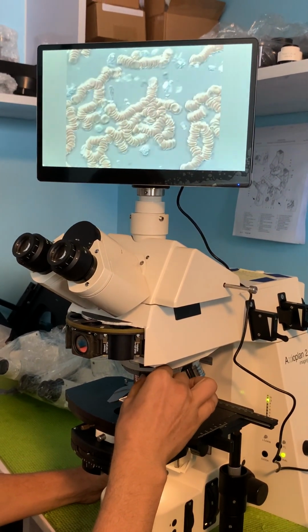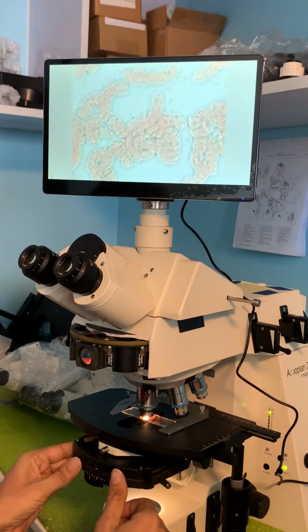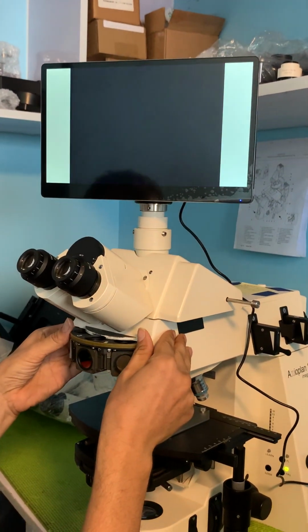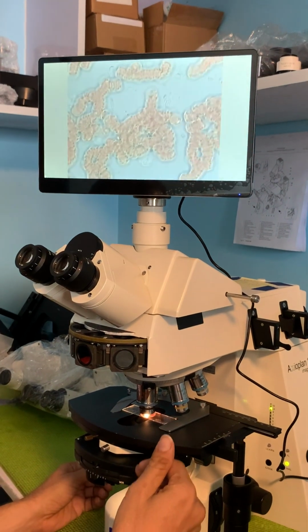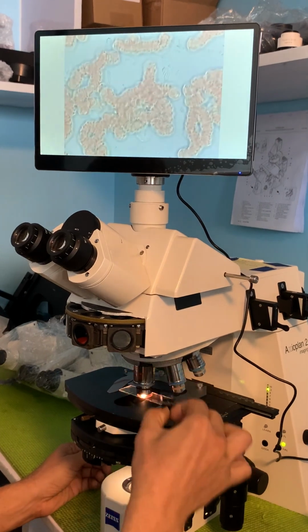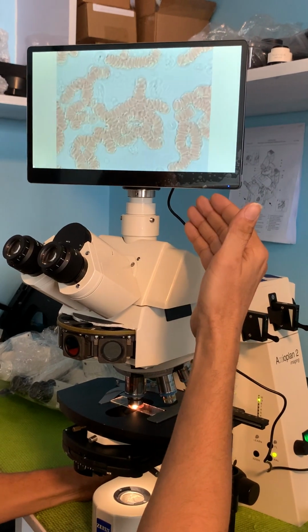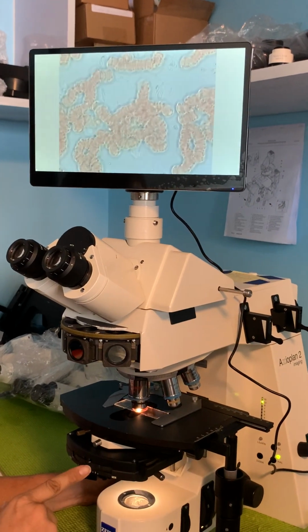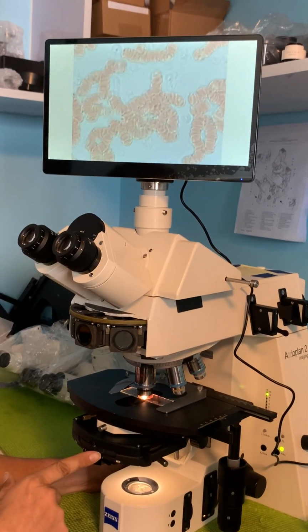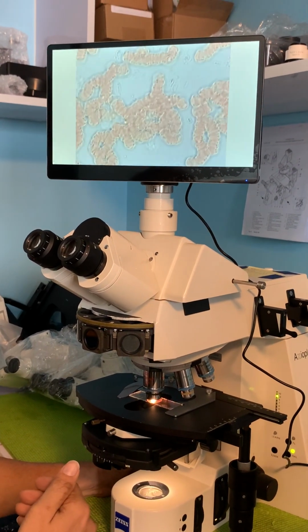We did try this with Darkfield Dry, and we did not get a very good image. Let's move over to Darkfield Dry. This is Darkfield. I'm going to pull off my analyzer. There's no analyzer, there's no polarizer, and now there's not even a DIC prism. And we're looking at Darkfield Dry. There's a Darkfield setting in this condenser, and it does not have the oil top on it. And that's as good as we get, which is really not that good.